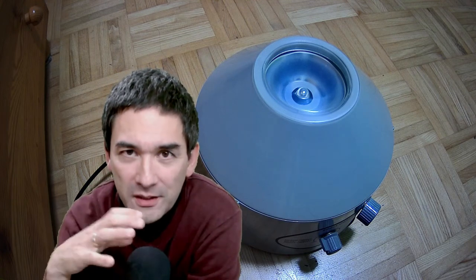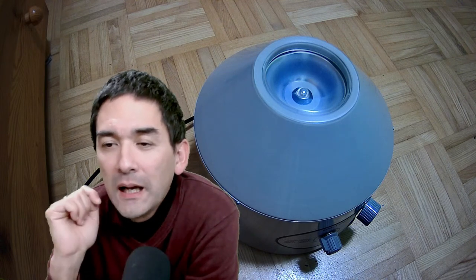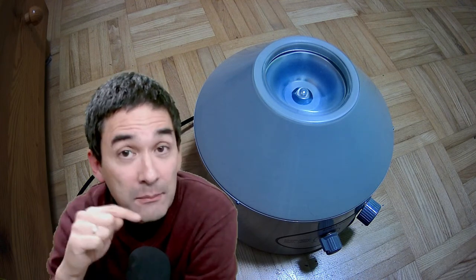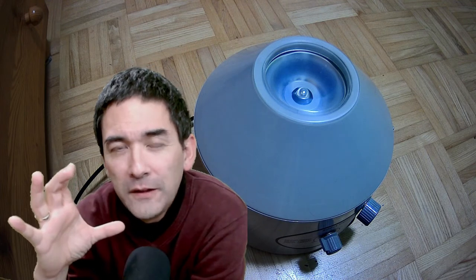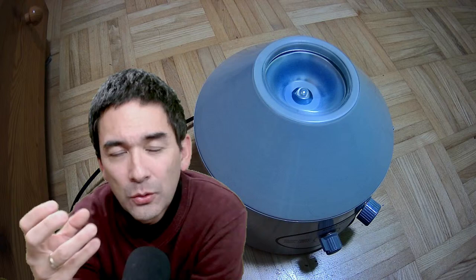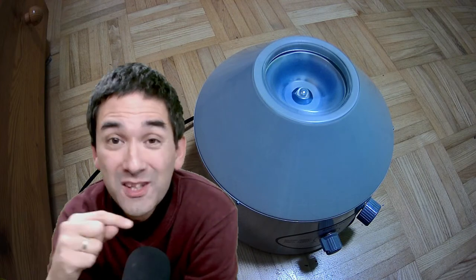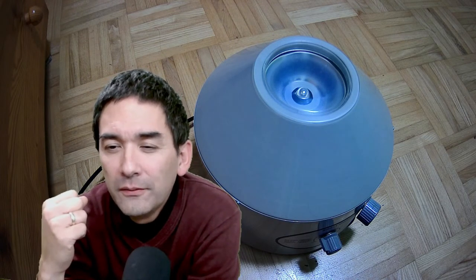Question: I have an old microscope with an extra lens that can flip over the condenser — what is this for? Some condensers, like mine, have a flip-out lens for low power magnification like 4x — at low power you don't get a full field of view otherwise. My current microscope also has the same thing: I have to flip out the lens when using the low power objective.